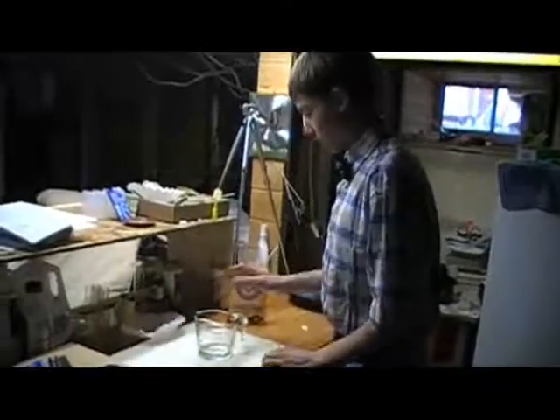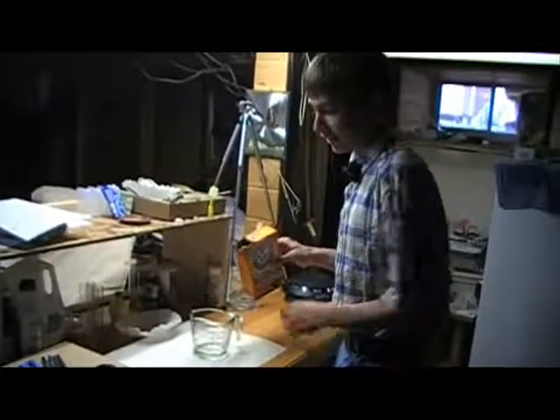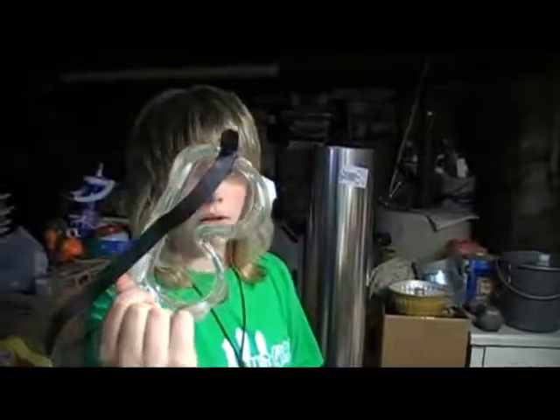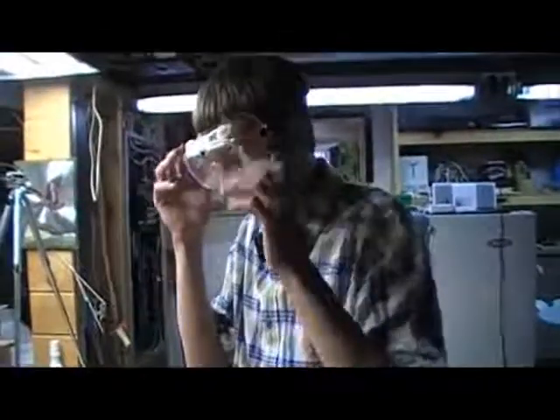Okay, so I'll just put some sodium bicarbonate into it. Wait! But in the first page of my book, I read that the goggles are the number one rule in the laboratory. So you must put these on. Okay, but you have to wear a pair too.